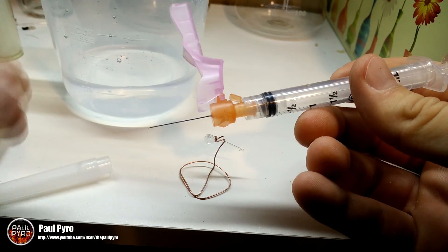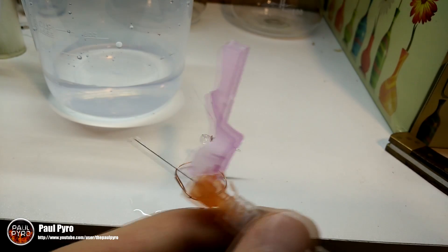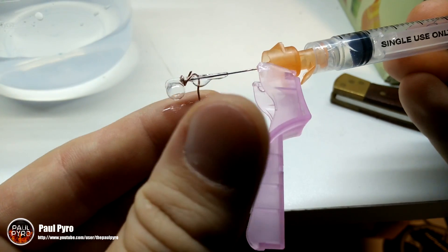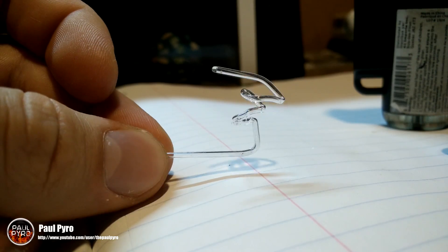The next step was placing water into the fine glassware, which is where this thin hypodermic needle comes into play. For the main distillation I'll just be using plain water, but any chemical could substitute. However, I then realized the bulb had actually sealed off from the tube, so it was back to square one and I had to recreate the retort all over again. One benefit along the way was that I managed to create some cool condensers which I could maybe use for future distillations.